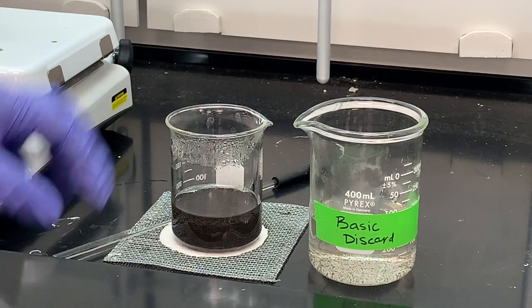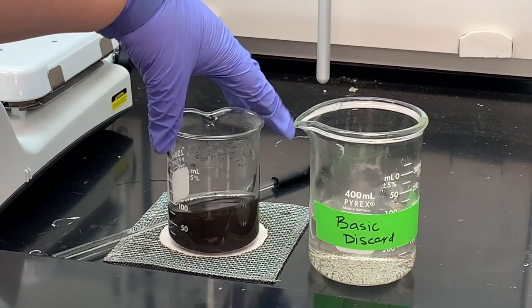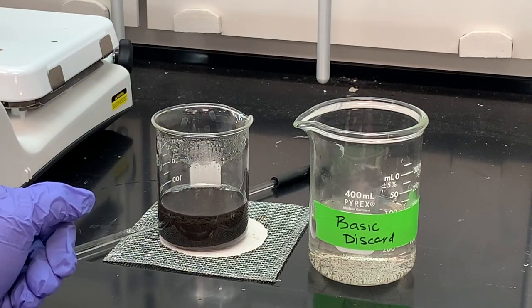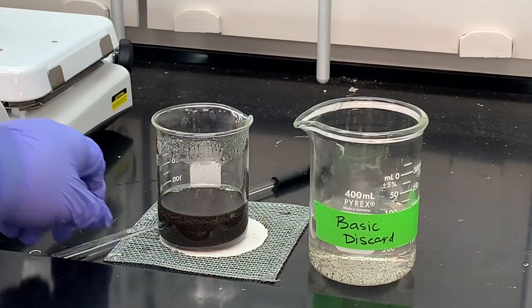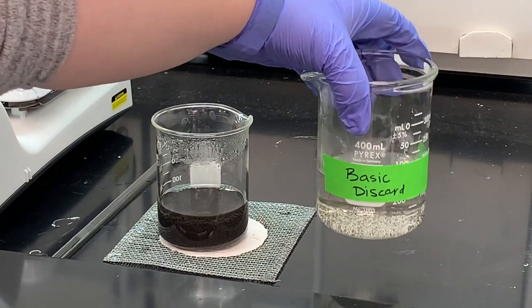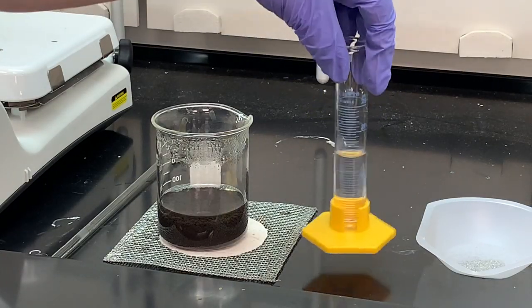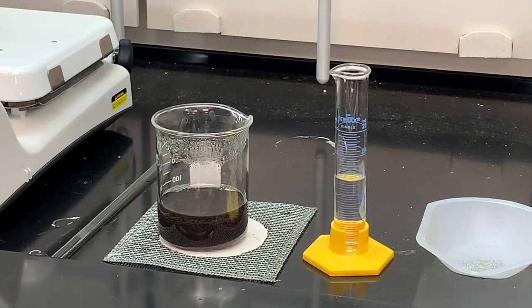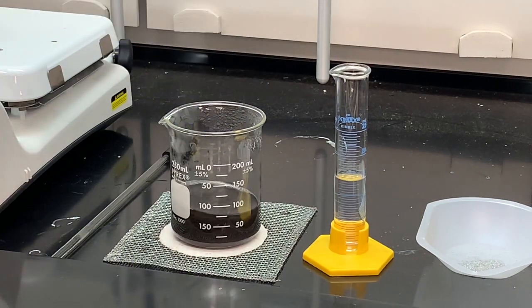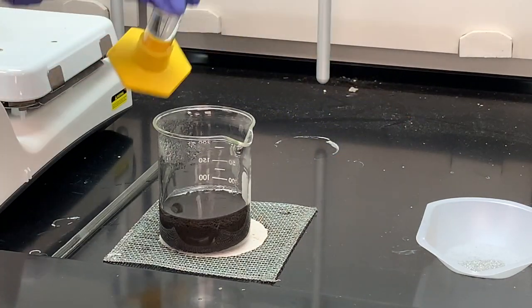The next part of this reaction is to add some sulfuric acid. I'm going to measure out 15 milliliters of sulfuric acid and add it to this solution. I'll remove the waste into a larger waste container. Now we're back — I have my 15 milliliters of sulfuric acid in my graduated cylinder and I'm going to add it to my beaker and stir that around.